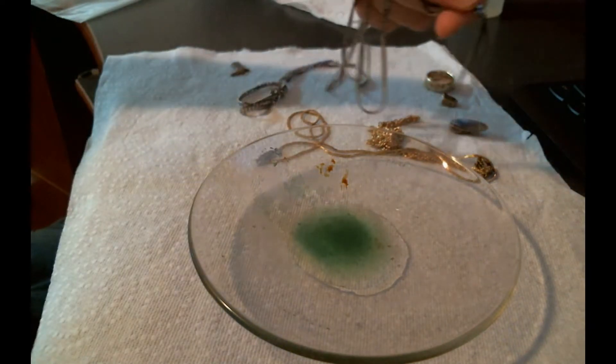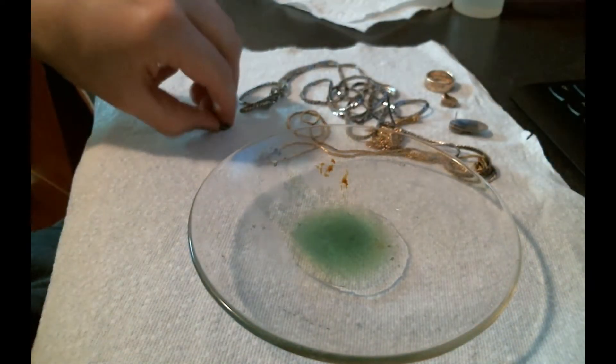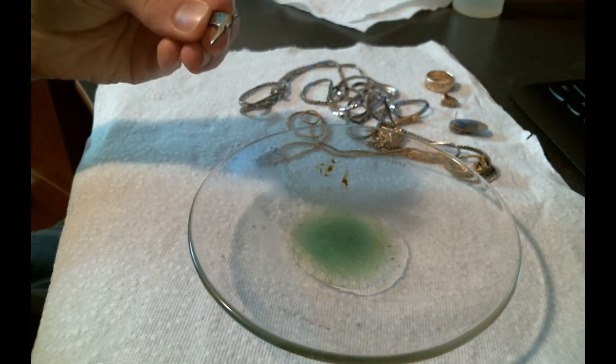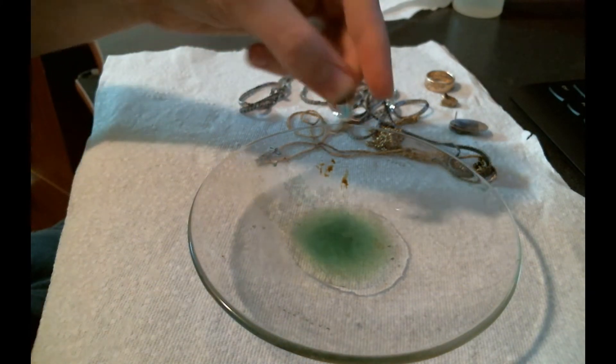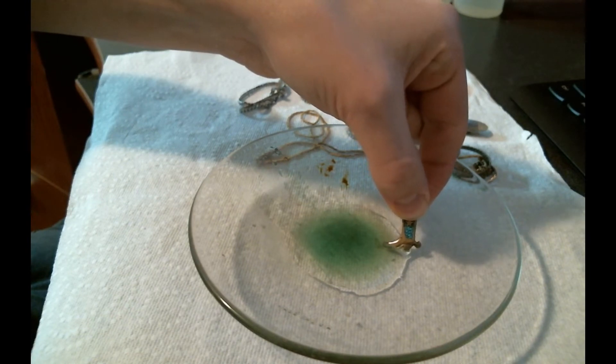Copper looks like gold, okay. It's copper, but it's probably got some zinc in it actually. It doesn't look like pure copper. If I put it in here, you can see that it definitely reacts.